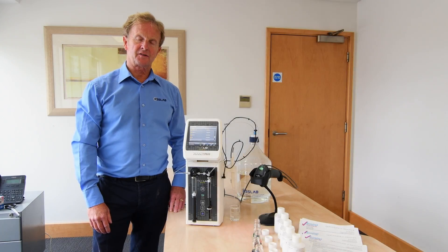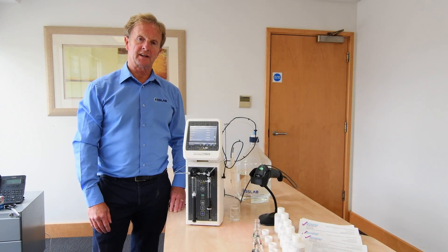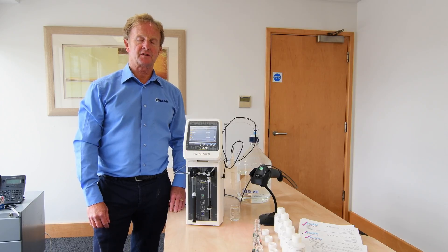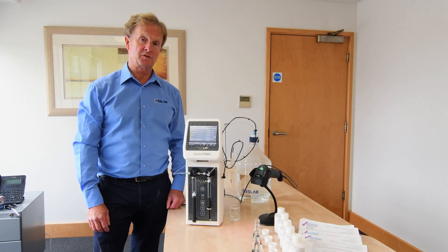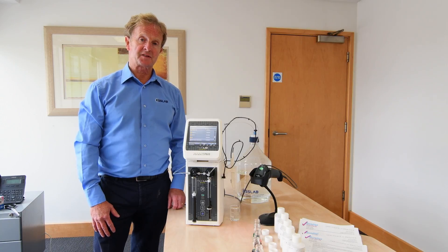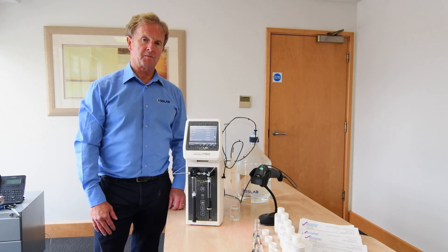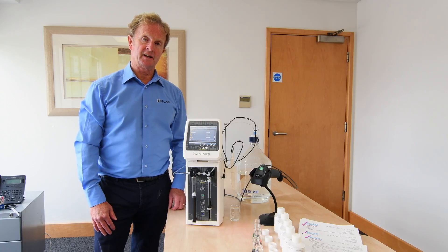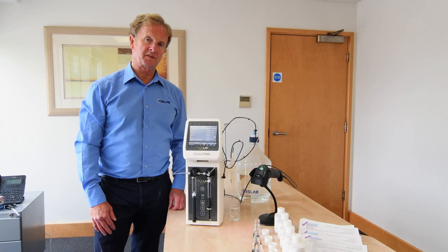This continues our series of short videos showing the Hamilton Microlab 600, focusing on some of the applications that the system can use. While it is often described as a dispenser or diluter, it can be used for a multitude of tasks in liquid handling using the custom programming functions and the wizards within the instrument.